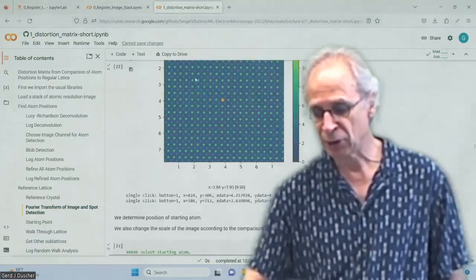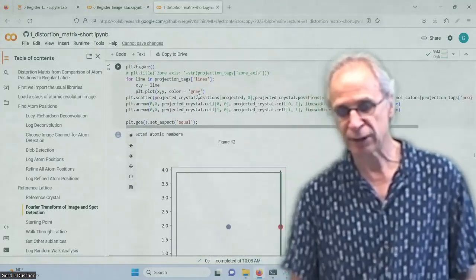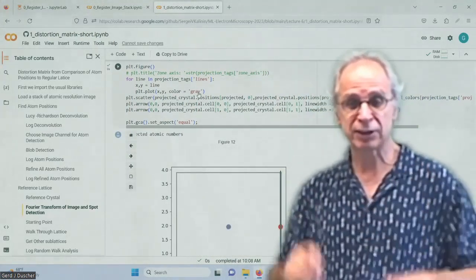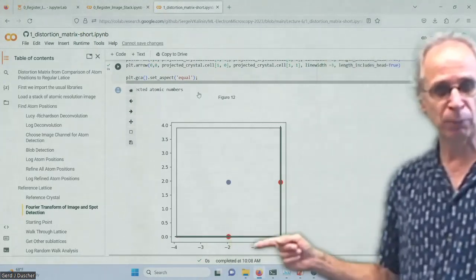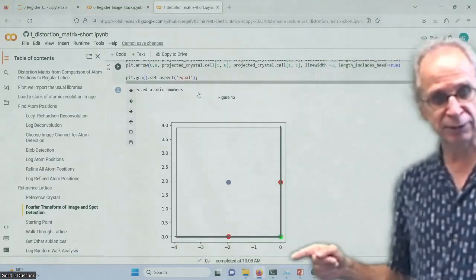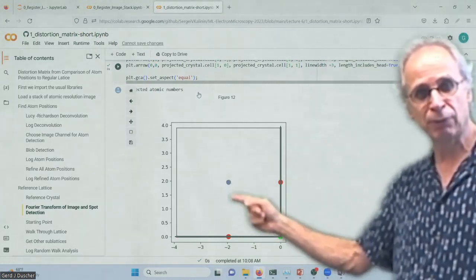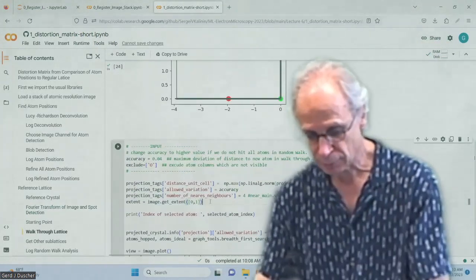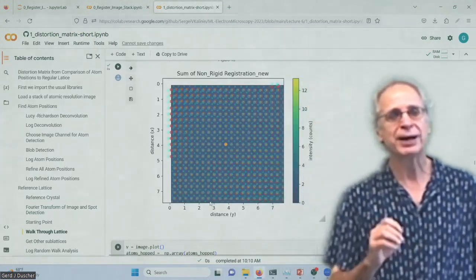So we determined the zone axis. We could have done that from the diffraction pattern. So obviously it could be optimized with machine learning. These things could be learned, right? And so again, we hop now through our atoms in steps of unit cells. We get our origin, and if we have the origin, we know where the other positions should be. Okay. And I do one more thing.